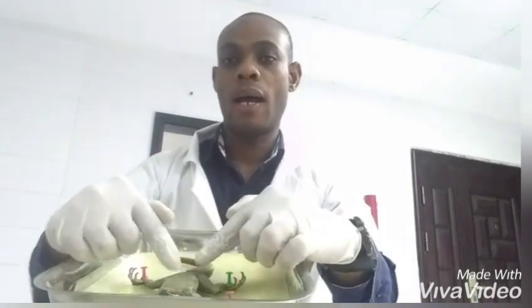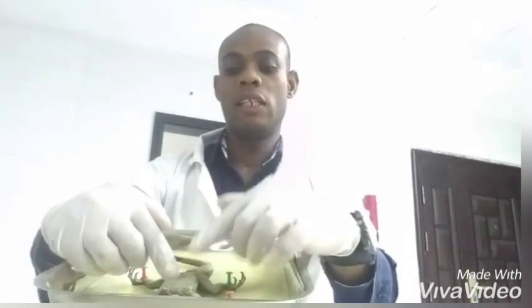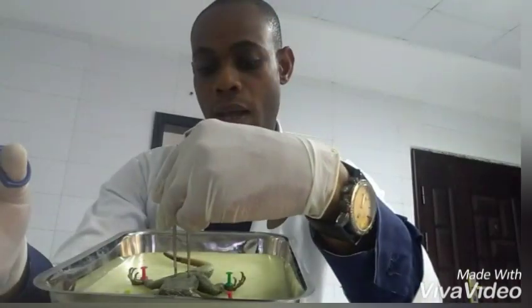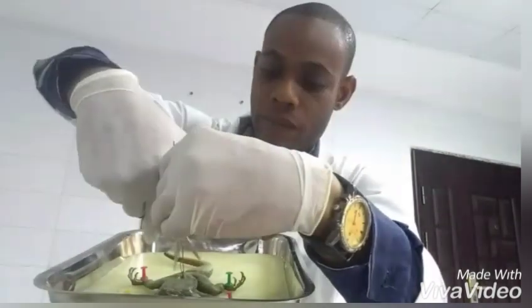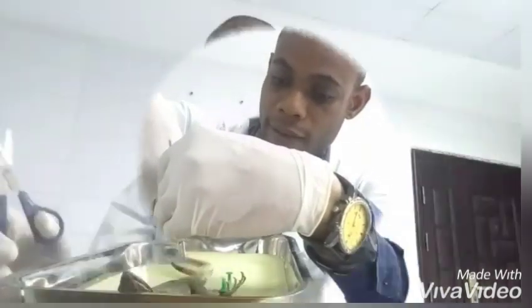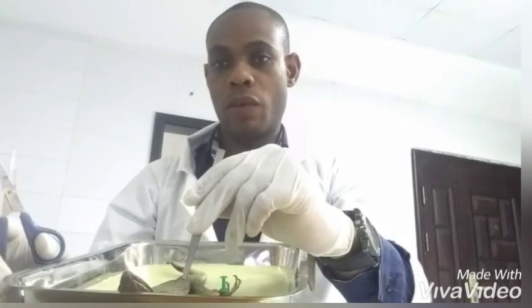The first thing that has to happen is that we'll be cutting through the lizard at the lower abdomen. We'll make a horizontal incision at the lower abdomen of the lizard. I'll take my scissors and my forceps — I'll use the forceps to hold the lower part of the abdomen and then with my scissors I make a slit.